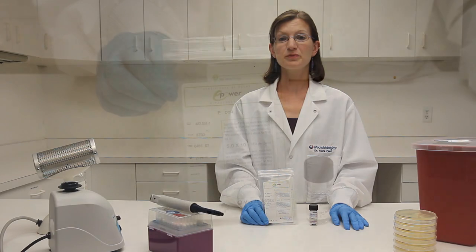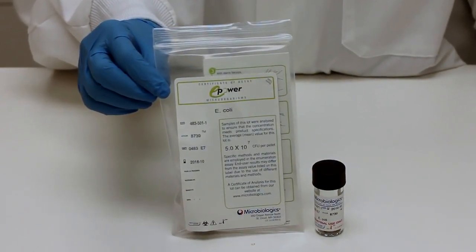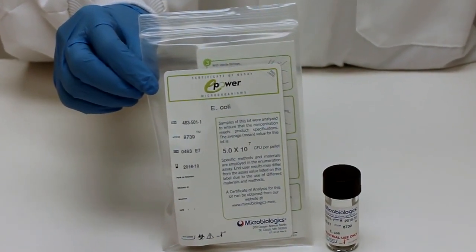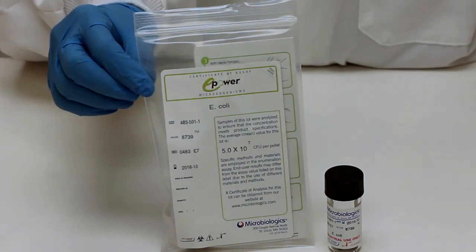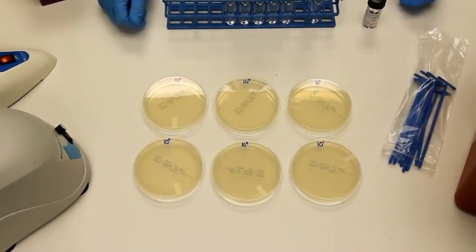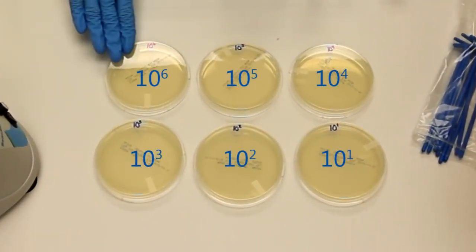Now I will show you how to perform a multiple dilution series with Microbiologics E-Power E7. First, label the plates with the dilution factor.